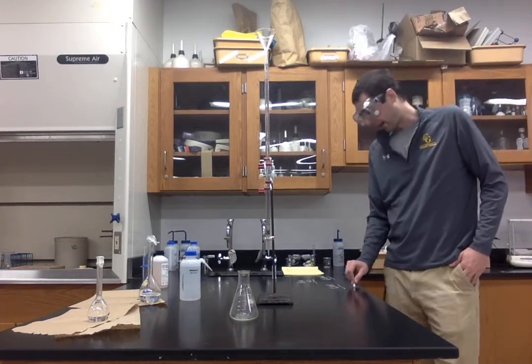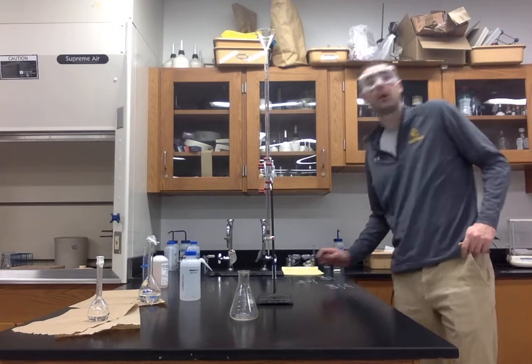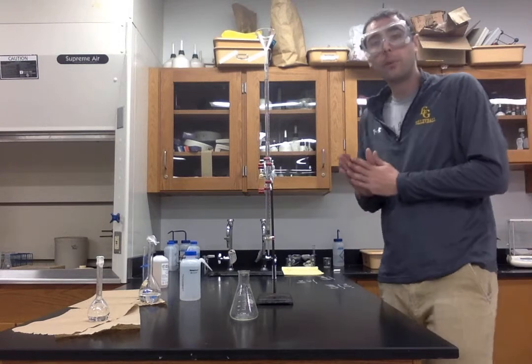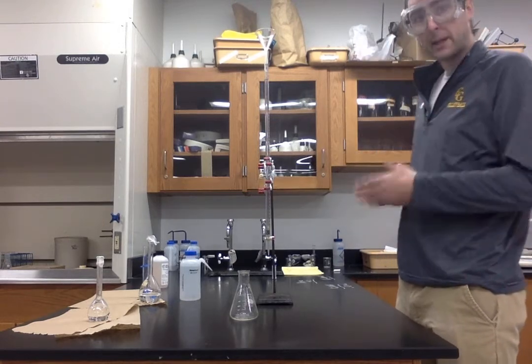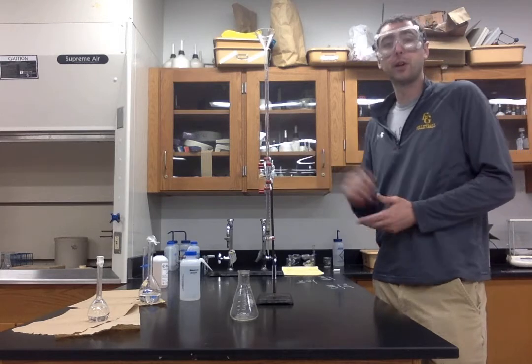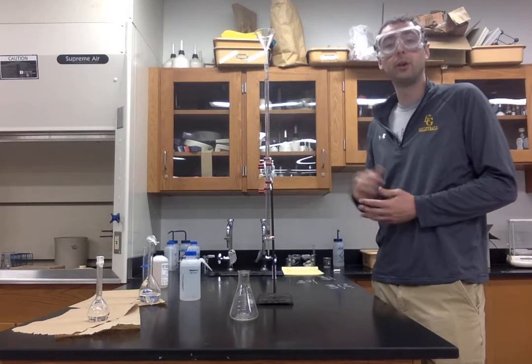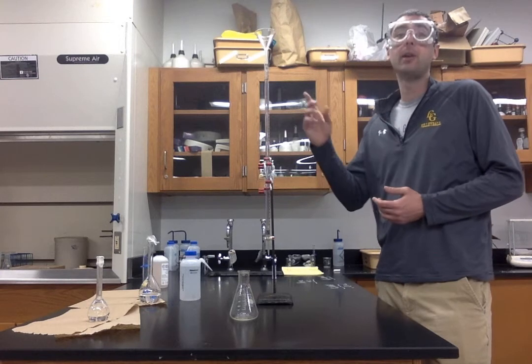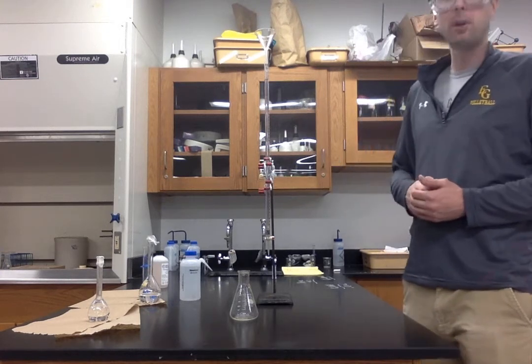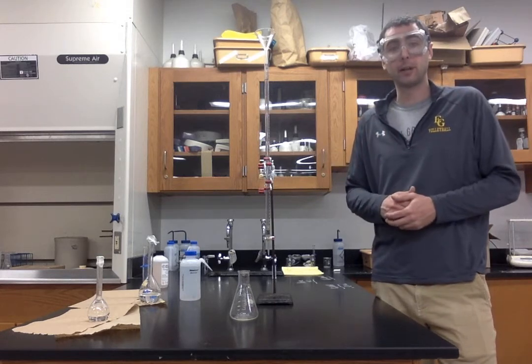Now, why is it important to know the amount of sodium hydroxide used? Well, look back to your balanced chemical equation. I know the concentration of the sodium hydroxide. If I know our concentration of sodium hydroxide and I know the volume used, we can multiply those values together to get moles of sodium hydroxide used.